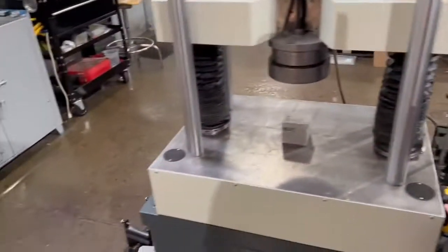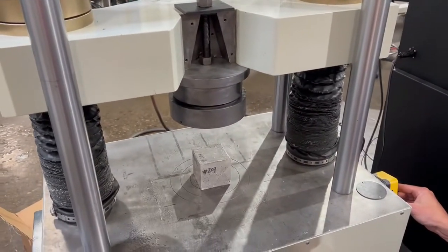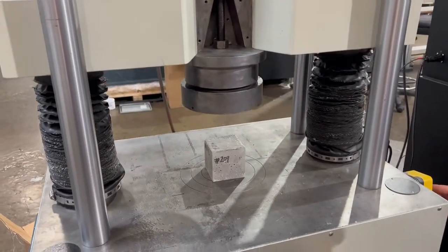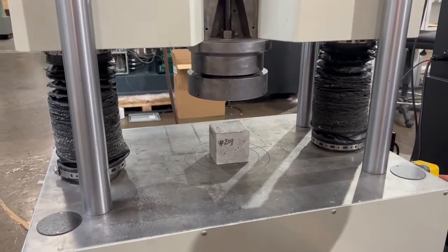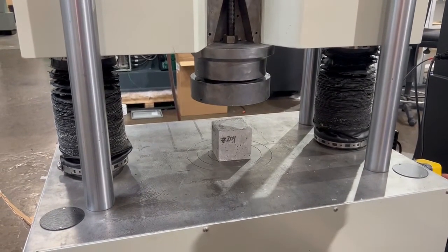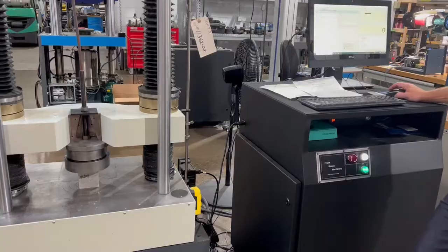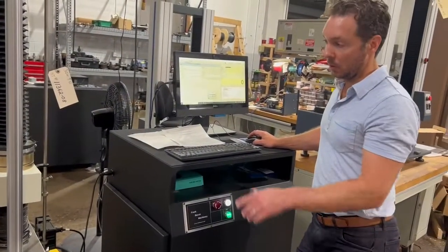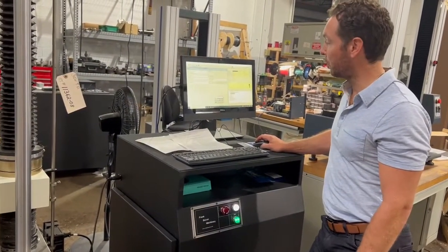I am going to bring this closer down to the specimen. Here we are, ready to start our test. Push the play button.